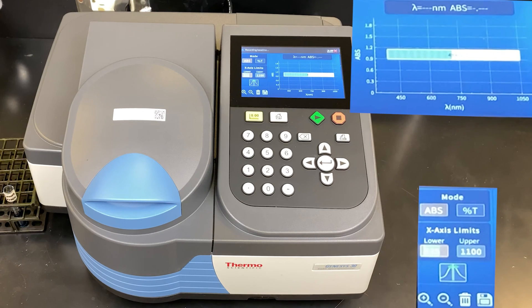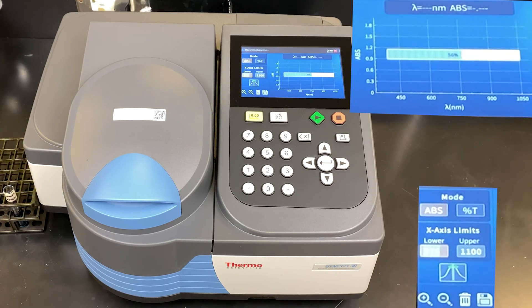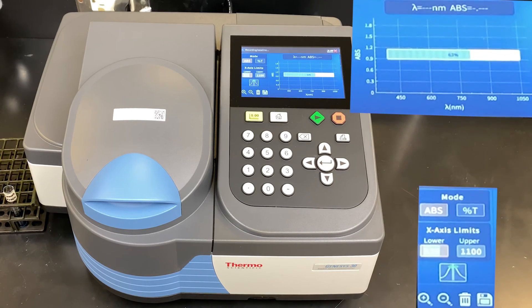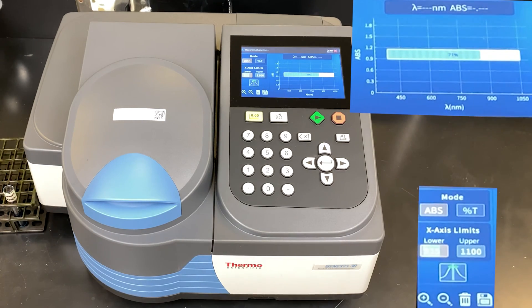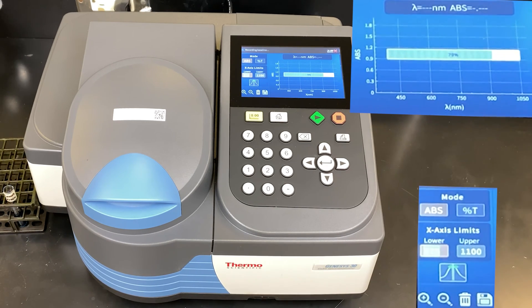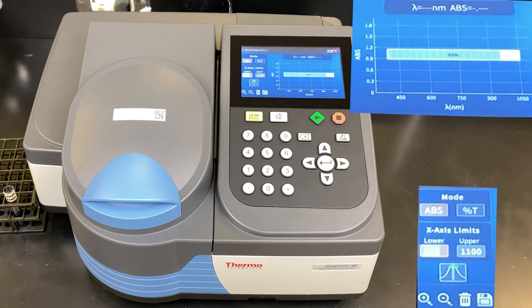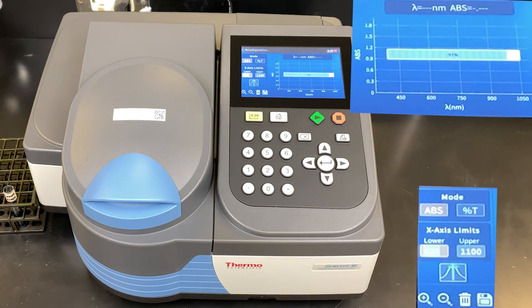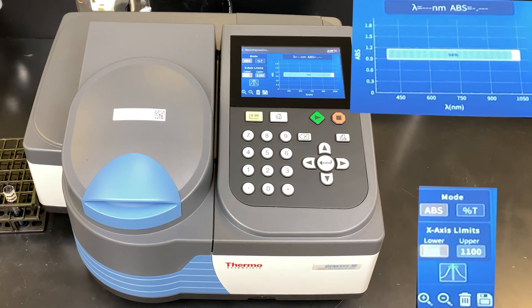The range of the scan can be adjusted using the x-axis limits. All you need to do is select the lower box under x-axis limits, delete it, and type in the number you would like for the lower nanometer wavelength. The same holds true for the upper nanometer wavelength. In this case, I've selected 325 nanometers as my lower limit and 1100 as my upper limit.